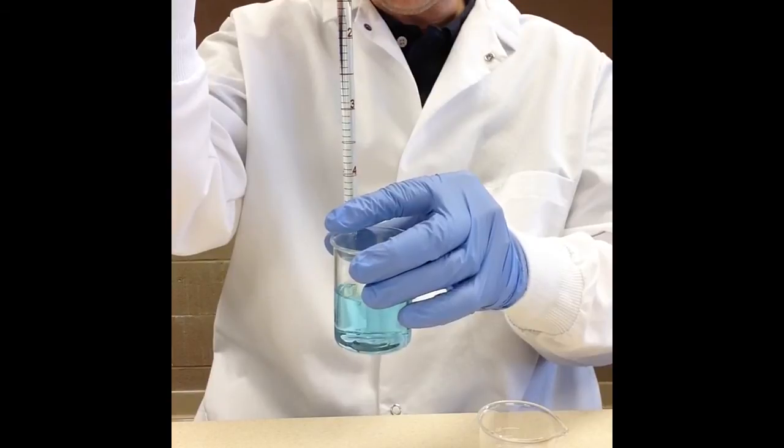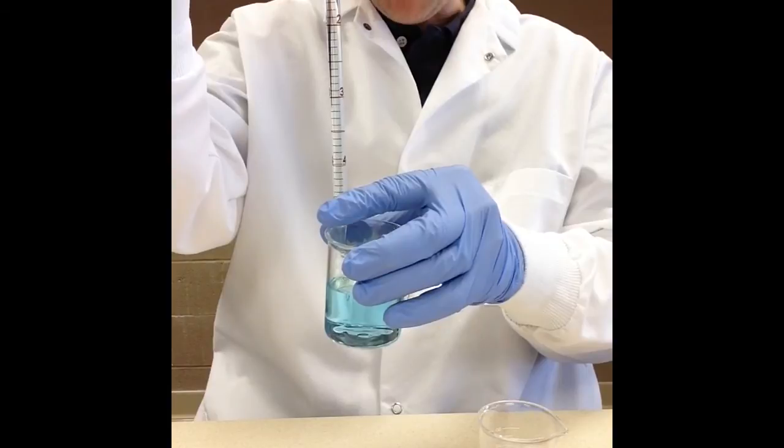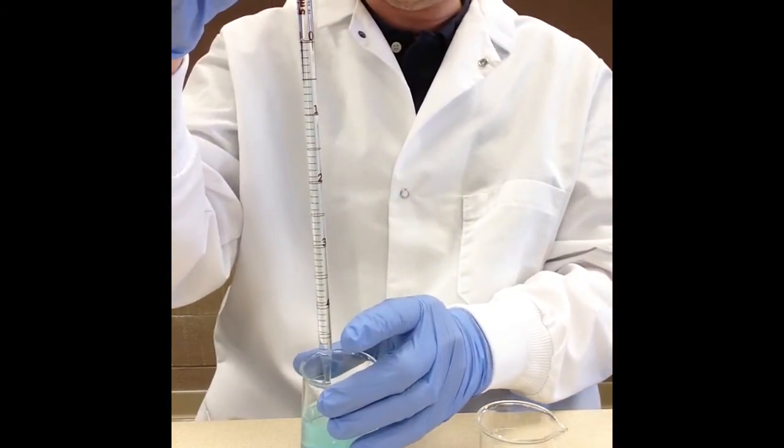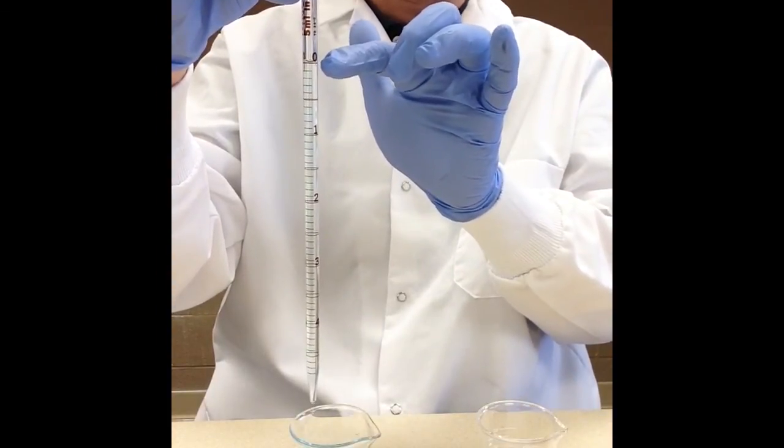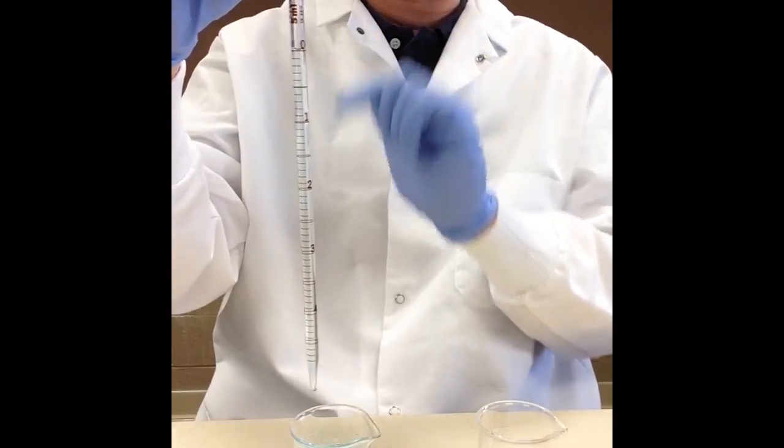This is something that definitely takes some practice. Okay there I've got it so the meniscus, the bottom of the meniscus is directly at, the bottom of the meniscus is lined up with zero so I'm ready to go.